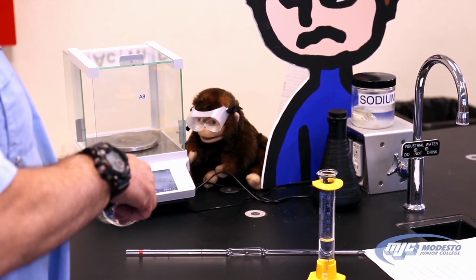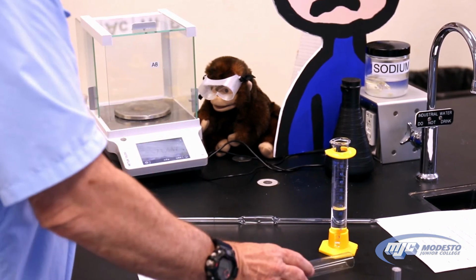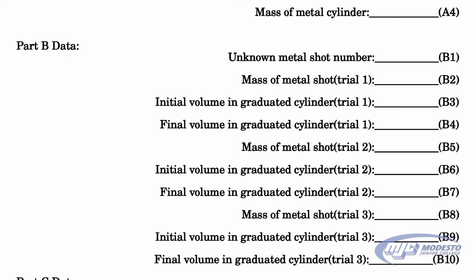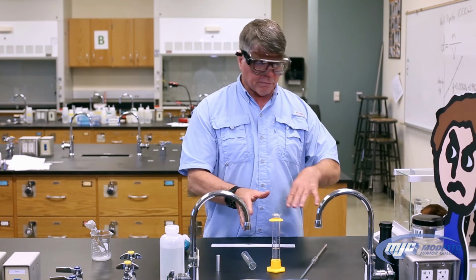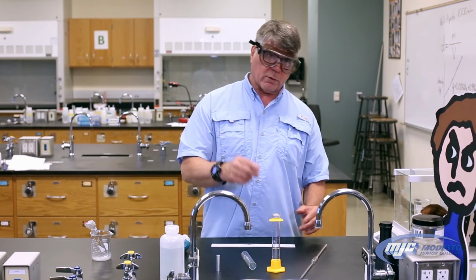We take the beaker out because we never pour anything directly onto the balance. And when you're pouring this metal shot into the beaker, you've got to be careful. Some of this metal shot is pretty dense. If you just dump it in, it'll break that beaker. Place it back on the balance. Get that mass. That's your B2, mass of metal shot trial 1. 3 places past the decimal, little g for grams. Now you're going to do this part of the experiment 3 times. So you go through, you do everything here, then you repeat, and that's when you take the mass the second time, that'll be your B5, and then the third time will be your B8.